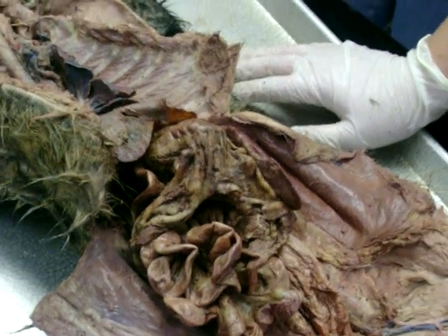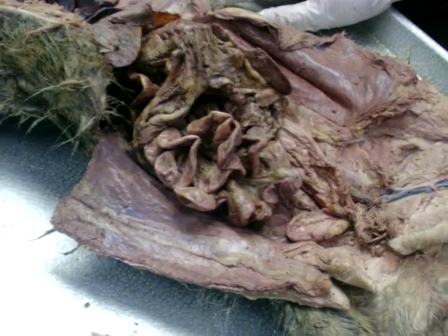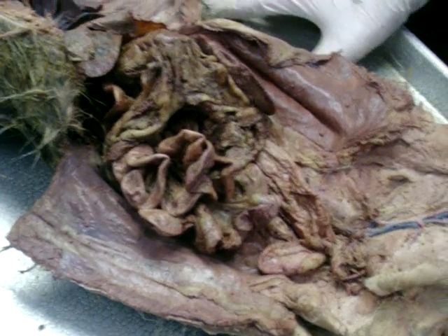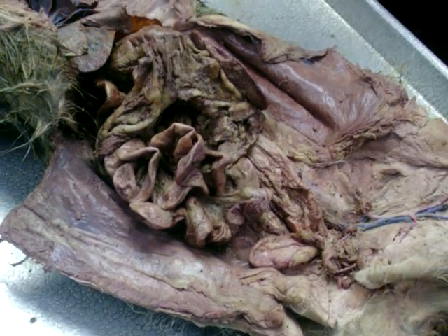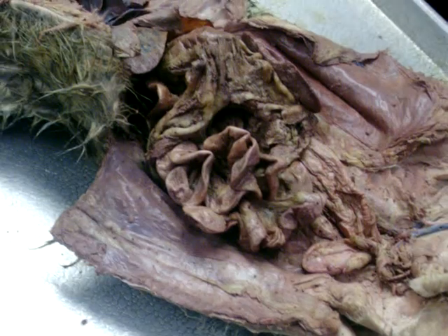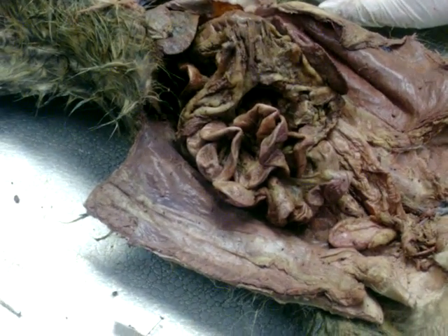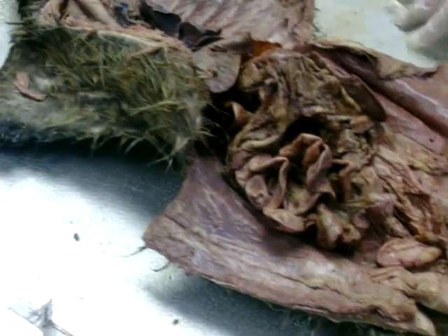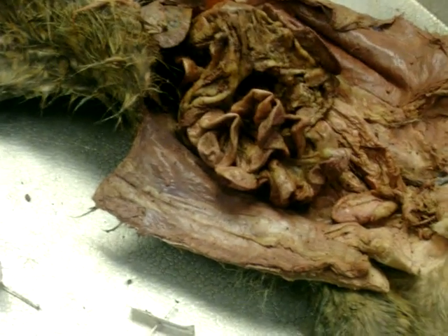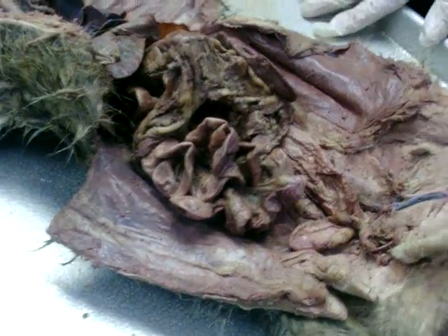And with the salivary glands, we only have the slide, and I'm like, you know what? We always have enough slides as it is, so the only thing I would ask would be, if I put up a slide of a salivary gland, that you could tell me it's a salivary gland, and I might ask, where would you find a salivary gland? In the oral cavity. Yeah. So that's hopefully one of the easiest slides. I just want to make sure you know what it is when you're seeing it, because we have a lot of slides to do.